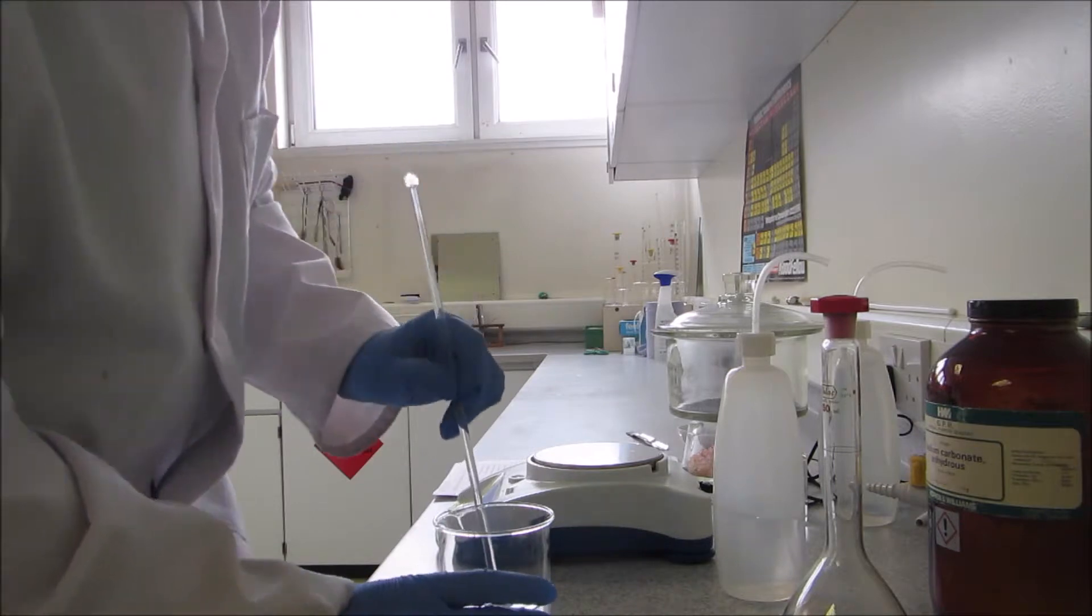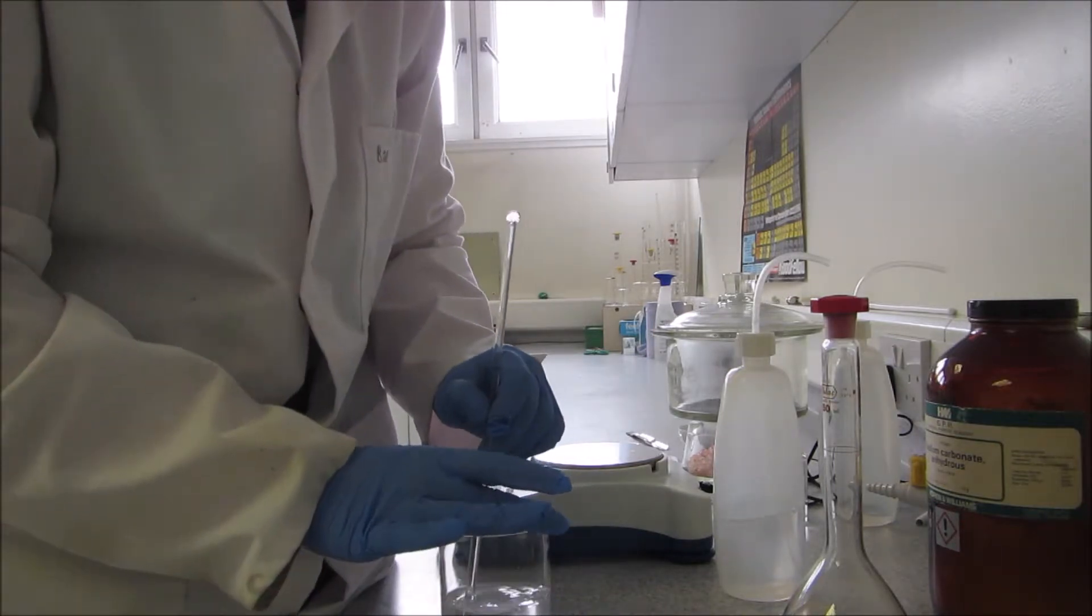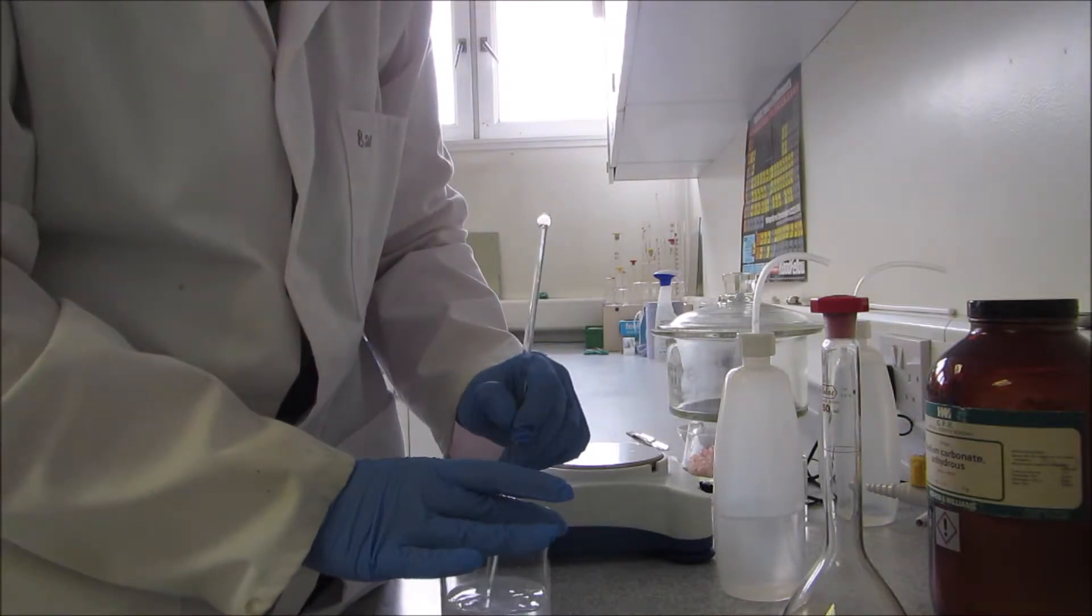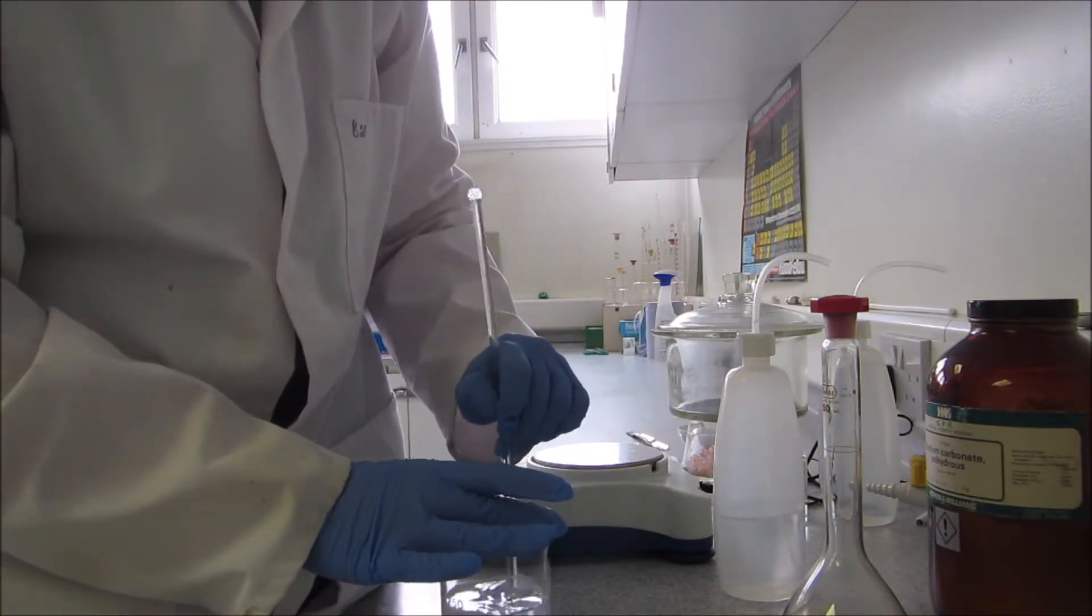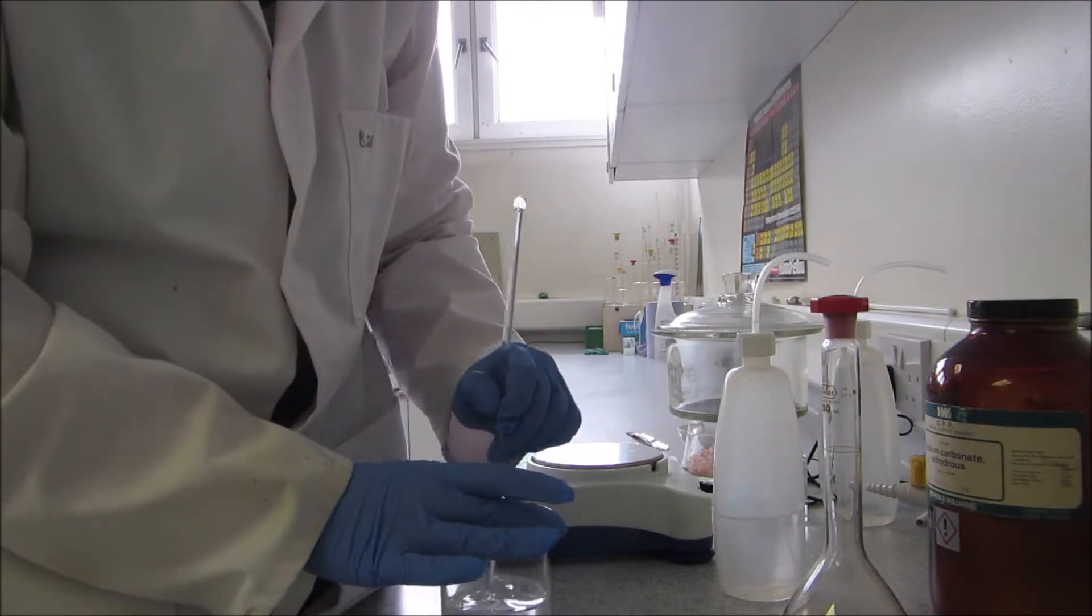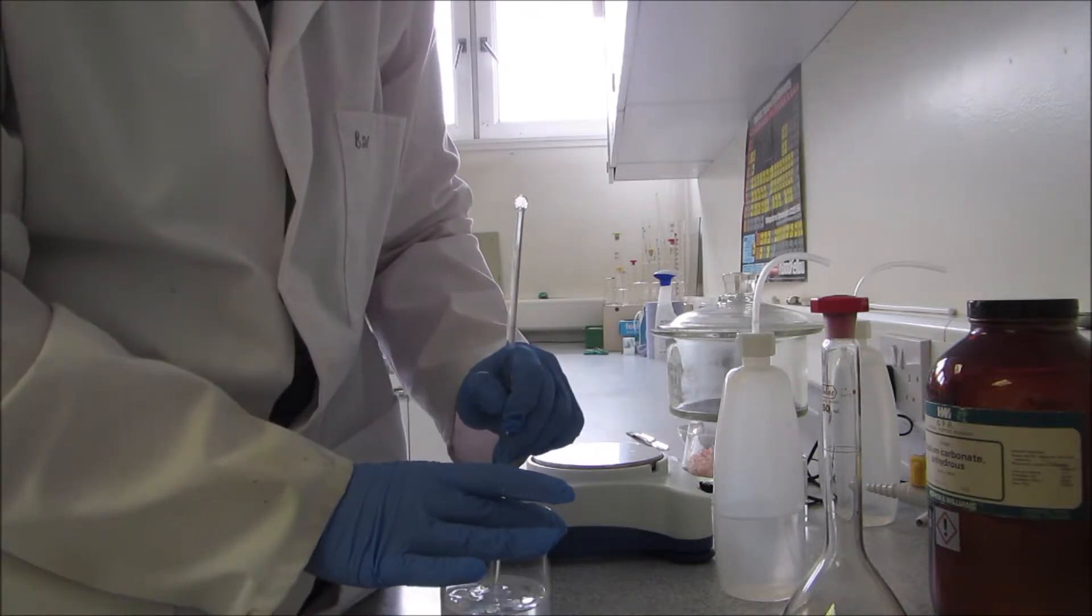Now I'll use my glass rod to mix it. You want to get it completely in solution. It's far easier to mix the salt inside a beaker than inside a volumetric flask.